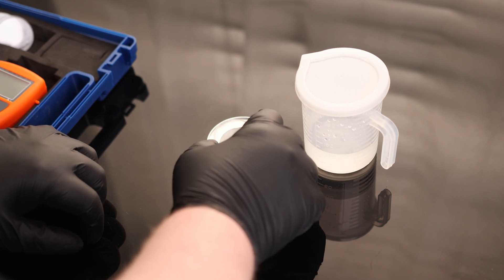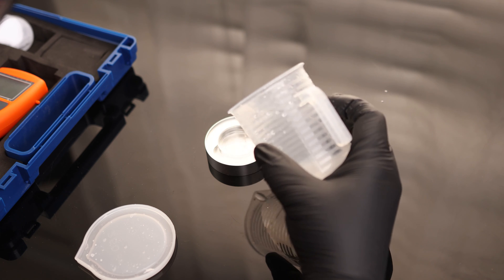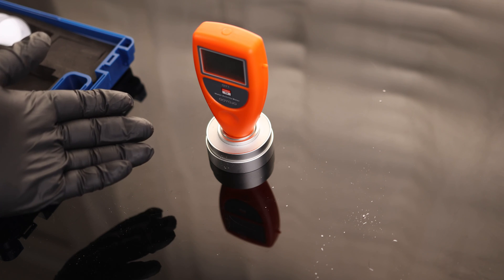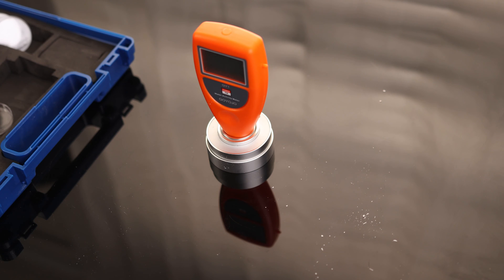I've let this sit for a day. I'm going to put the testing cup inside the chamber and fill it about halfway up. Now we have to let this sit for about 10 to 30 minutes — I'm just going to let this sit for a half hour. It does not need to be on, so we do not need to worry about wasting battery power. I'll leave it off, sealed in the chamber for 30 minutes, and then come back and turn it on to see what the reading is.